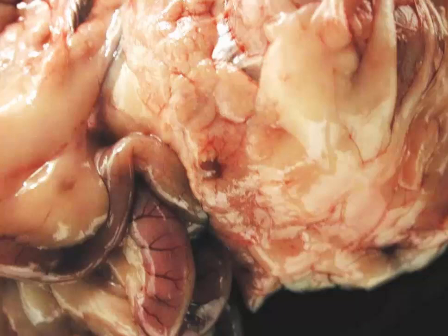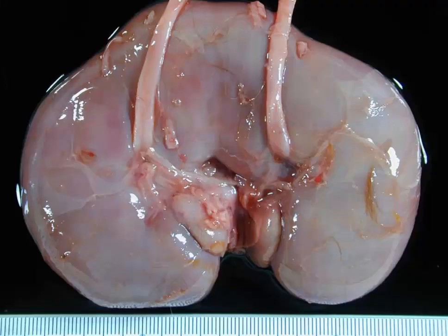Okay, slide number 4. Okay, slide number 4 is tissue from a horse. Can you give me a morphologic diagnosis? Okay, time's up. This is a very common congenital abnormality, especially in people, and it's thought that 1 out of every 1,000 people have this congenital fusion of the kidneys, which is known as a horseshoe kidney.